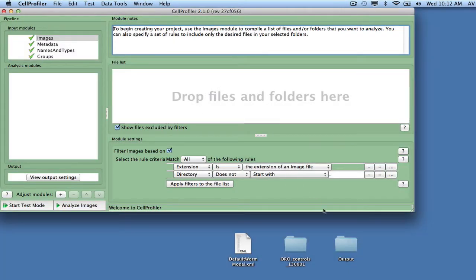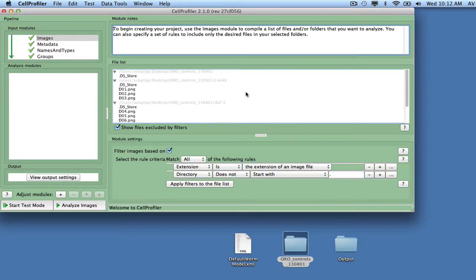To provide CellProfiler with image files to be analyzed, drag and drop the input image files into the file list space. For the model to be able to handle the variability in shape seen in a broad spectrum of phenotypes, we start by selecting a few images from each of the L4440, DAF2, and PEB1 phenotypes. The goal is to find approximately 40 to 60 non-touching worms as input for training the model.